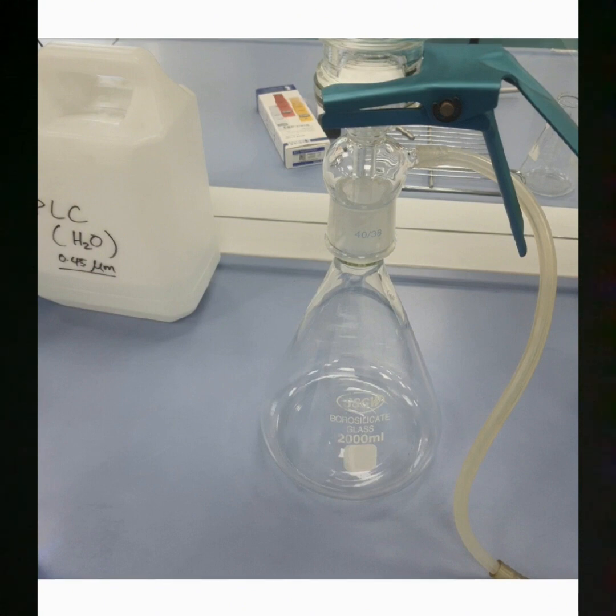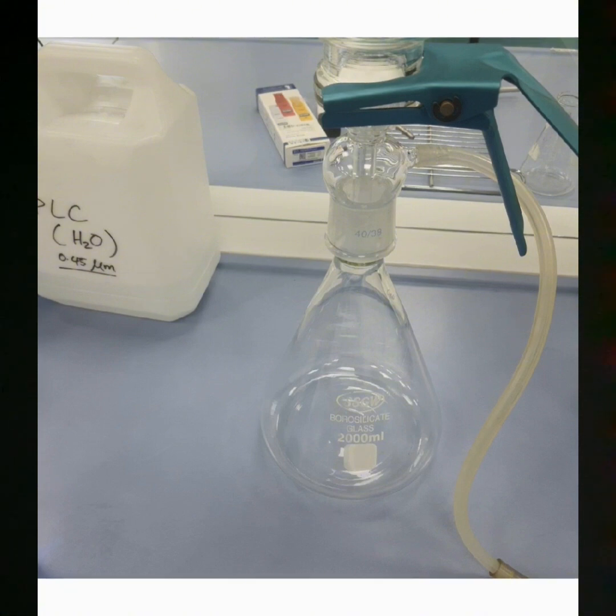This system is basically used in laboratory vacuum filtration, so it can intercept particulate matter, clarify filtrate, sterilize, solid liquid separation, degassing, defoaming, and other purposes.